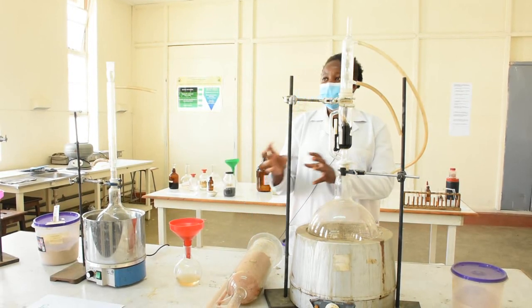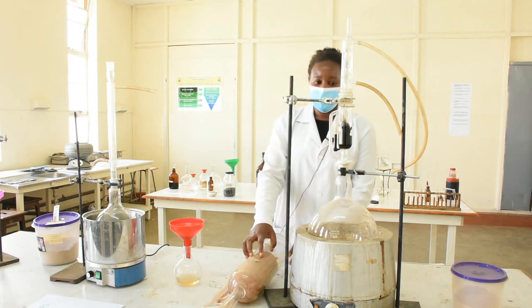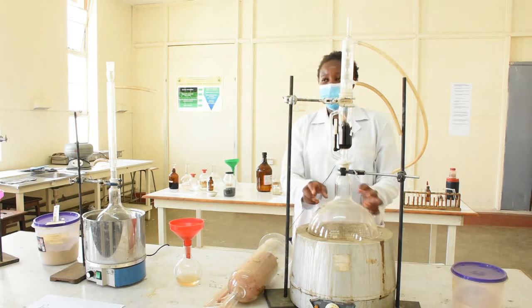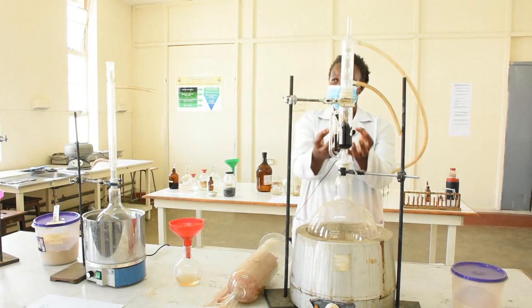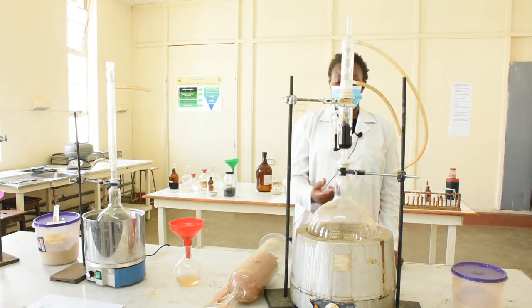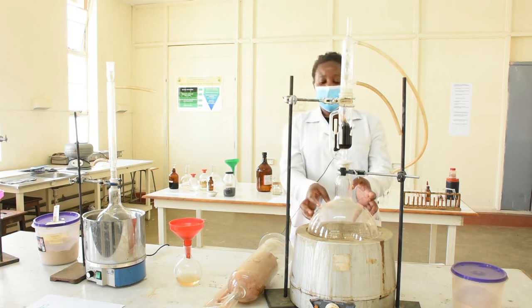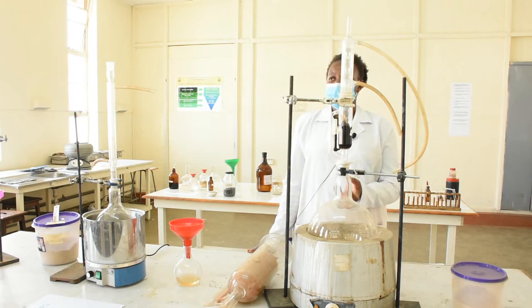We run it for several hours until we exhaust. We will be left with a solvent that we don't need to filter. We normally reduce it to get a smaller quantity of concentrated extract.